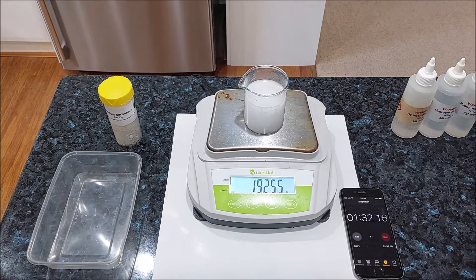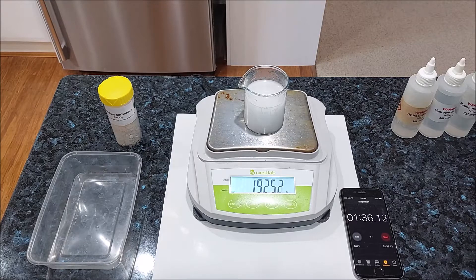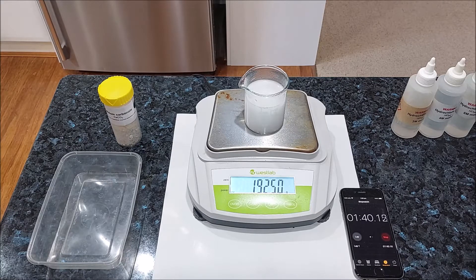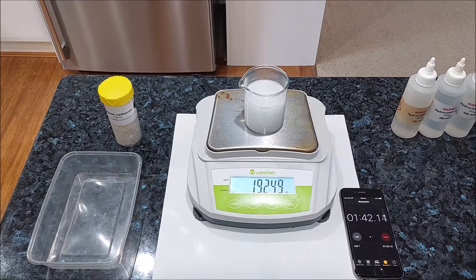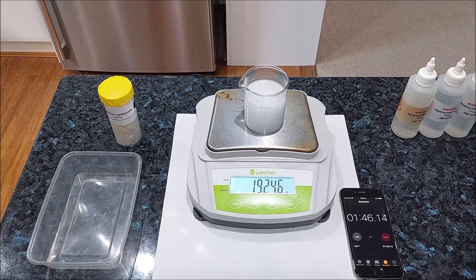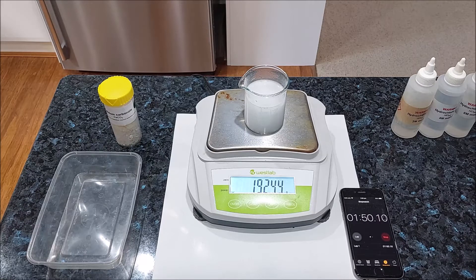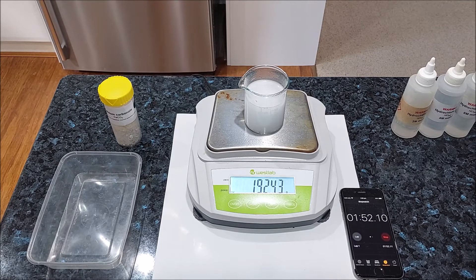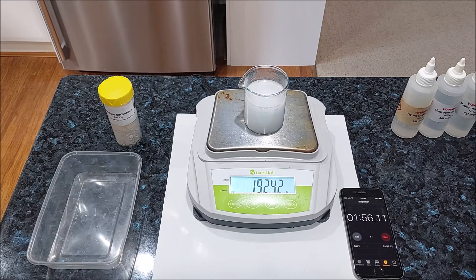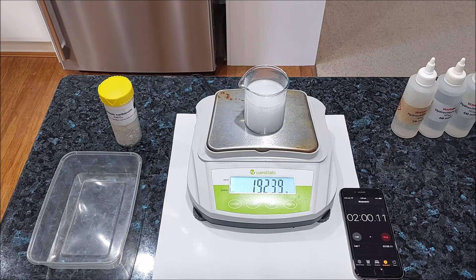Just 30 seconds to go. 3, 2, 1 — read it.